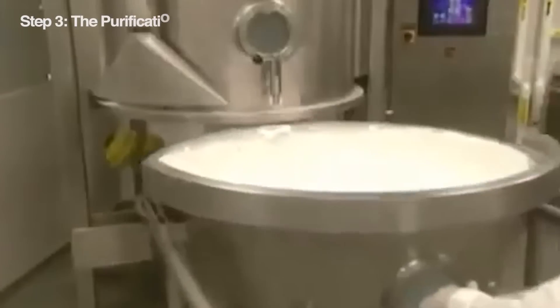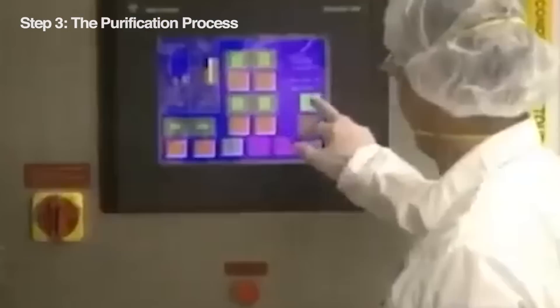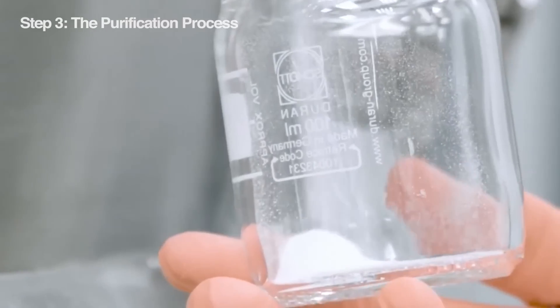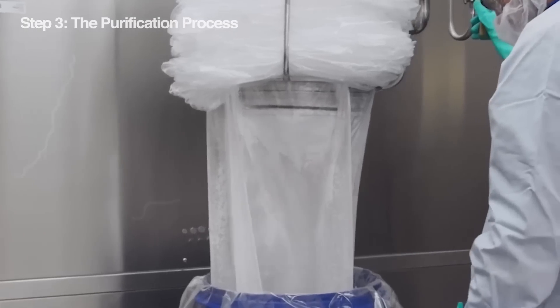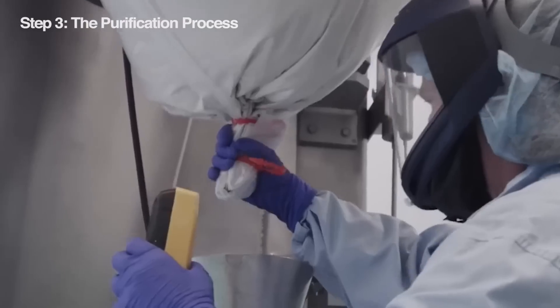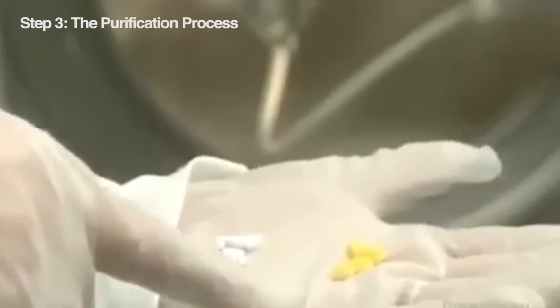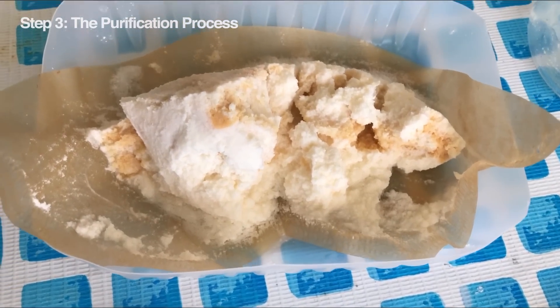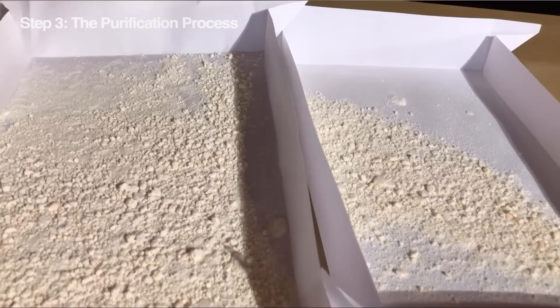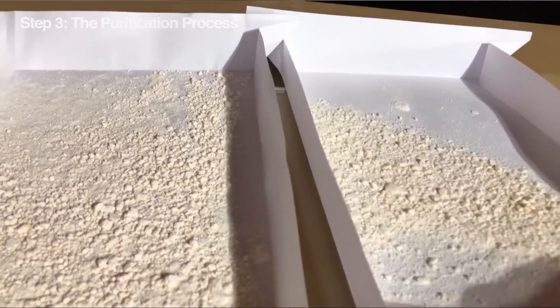But it doesn't end here. We've mixed our ingredients and watched the chemical reaction create something awesome, but the aspirin isn't quite ready for use yet. It's still a bit rough around the edges, with some unwanted impurities clinging on. We need to separate the good stuff from the not-so-good stuff — a process called crystallization. We use a special solvent, like water or ethanol, to dissolve everything. Then we crank up the heat a little, helping the impurities separate. As the solution cools down, pure aspirin crystals start to form, leaving the impurities behind. This purification process ensures that the final aspirin we get is pure, safe, and effective.